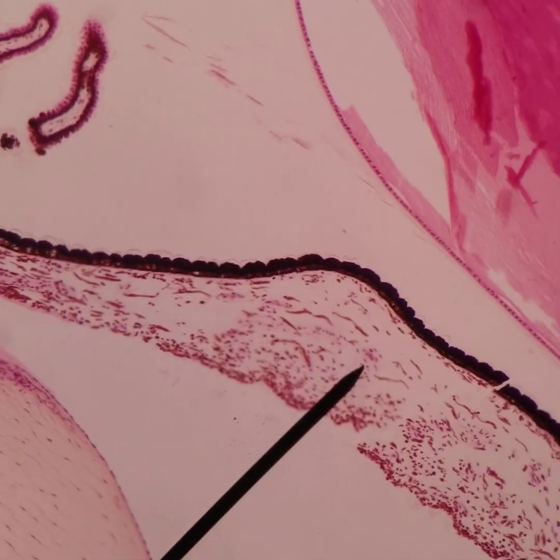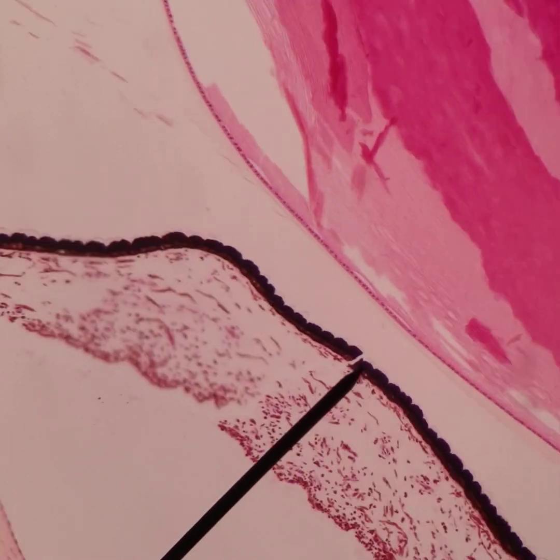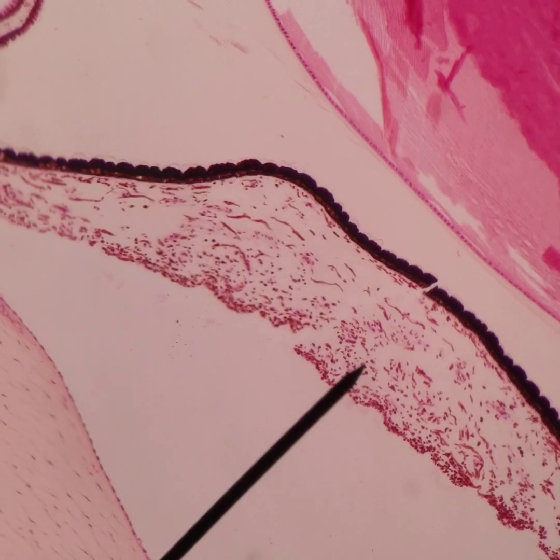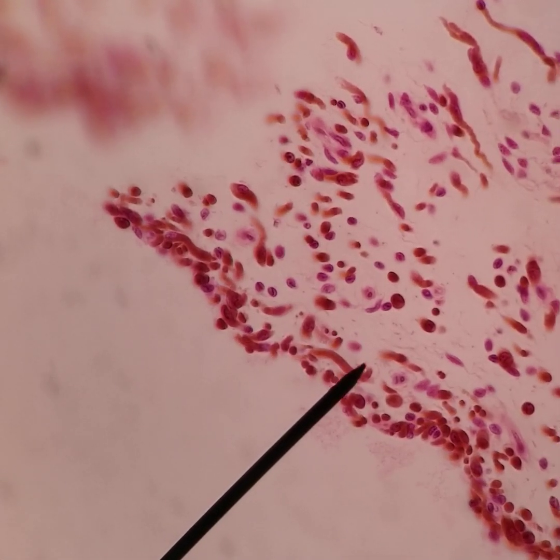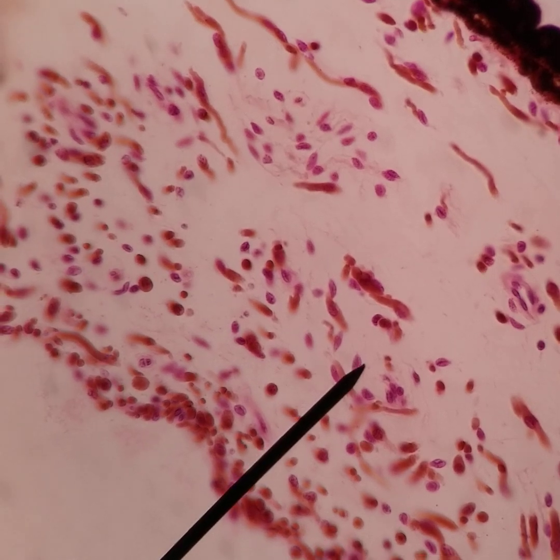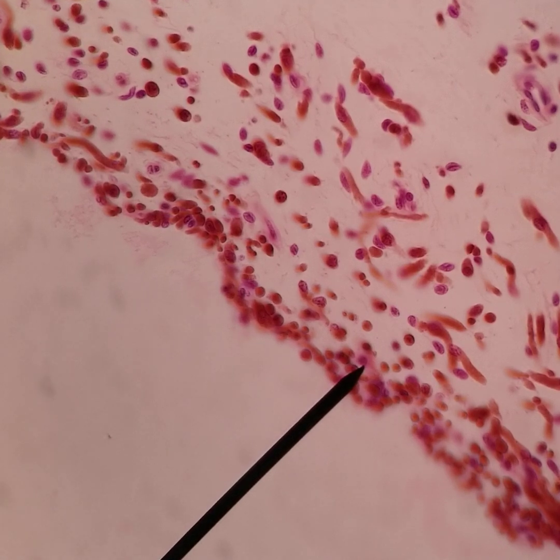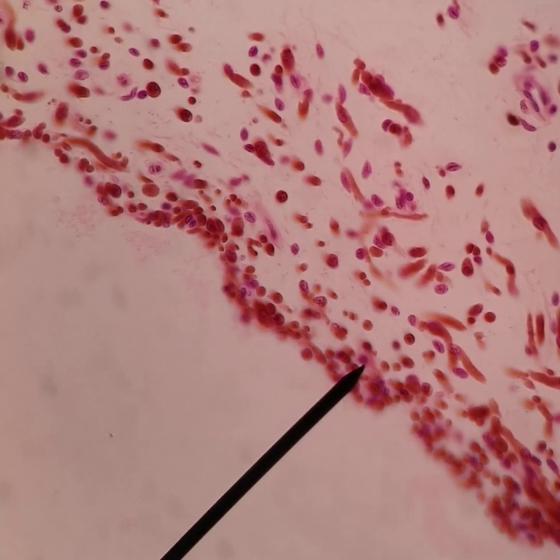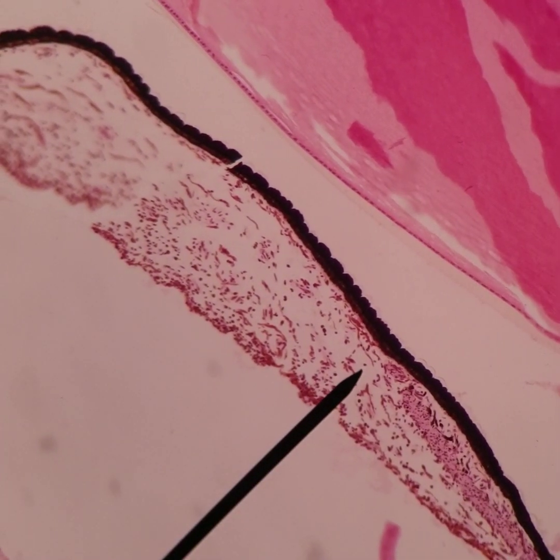We're going to transition right into the iris and take a look at the different layers. Most anterior is the anterior border layer — remember, that's not an epithelium, it's just dense pigmented cells. Posterior to that we have the iris stroma.